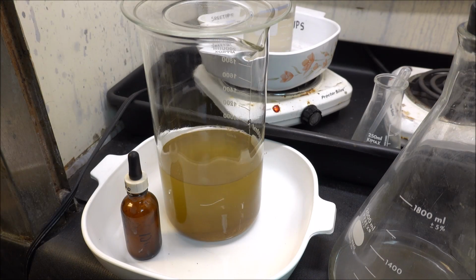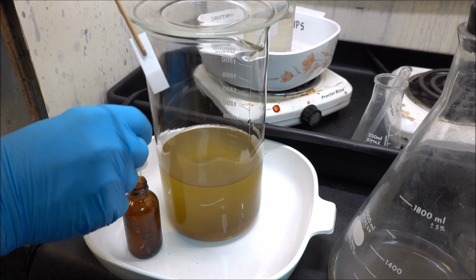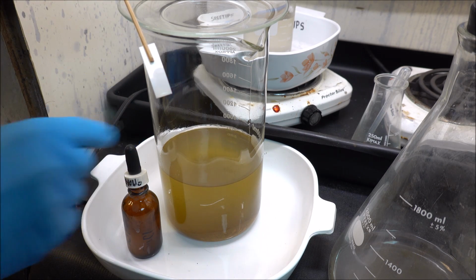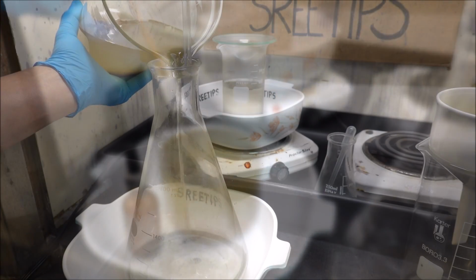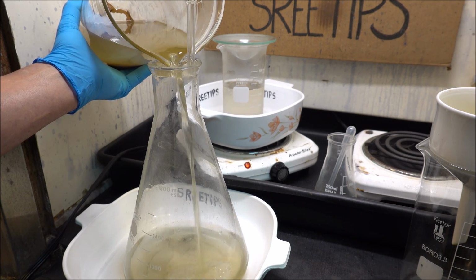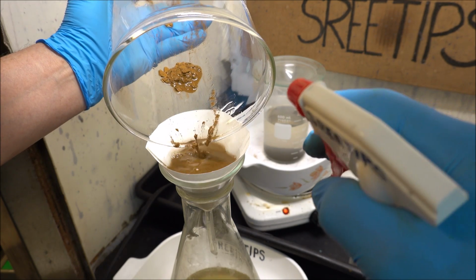What I'm going to do is get a stannous test. Make sure we got all the gold out of our solution here. And as you can see, no reaction. All the gold has been precipitated out of our solution. Here I'm pouring off the waste solution into that flask. That'll be added to my stock pot later on. And then I get the gold down into a filter paper so we can get it melted.